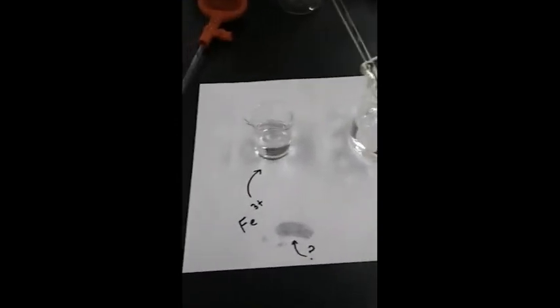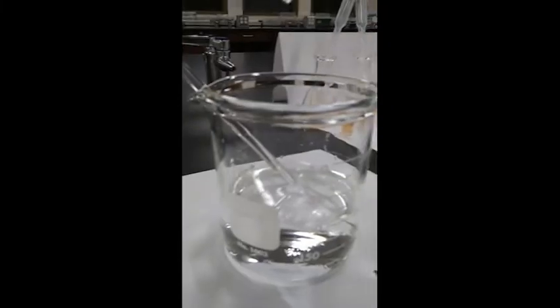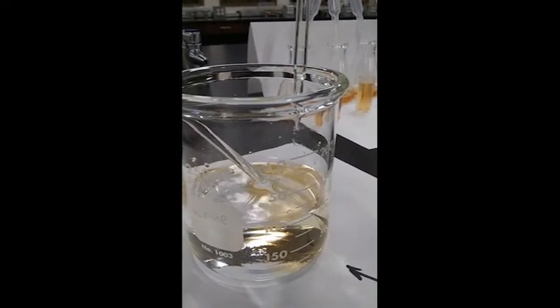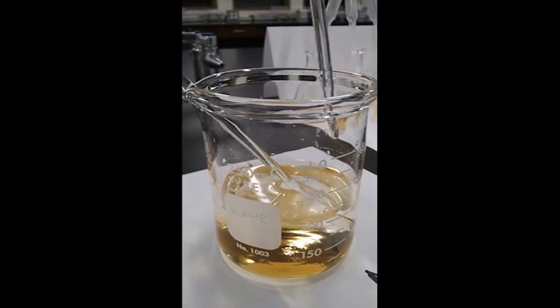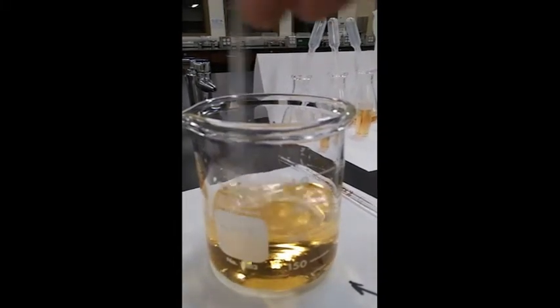I'll be pipetting one milliliter of the iron(III) into the potassium thiocyanate. Important tech tip: it's really important to do this on a white piece of paper. The white paper provides color contrast, making the color all that much easier to see. Notice the orange color is formed as I deliver the iron(III). Touch the tip. Then I'll go about swirling to produce a nice homogeneous mixture.